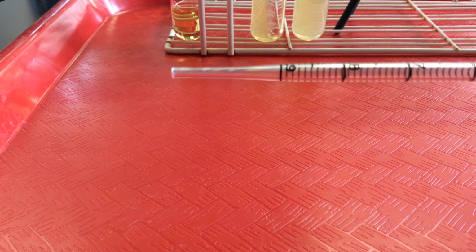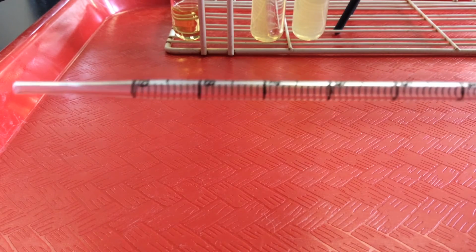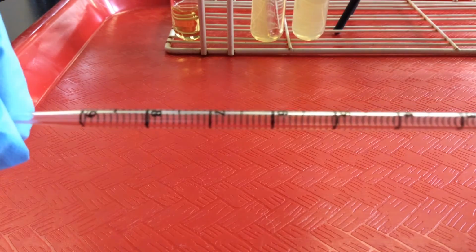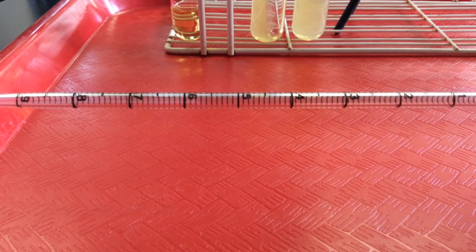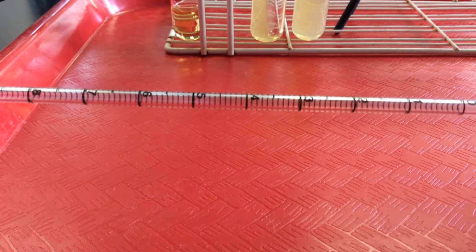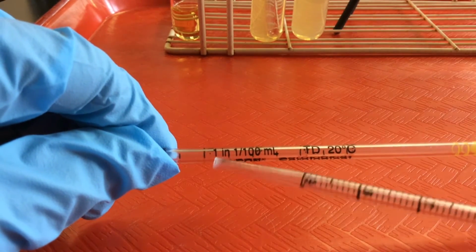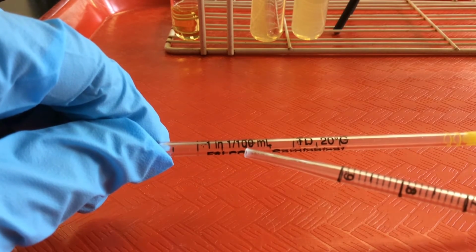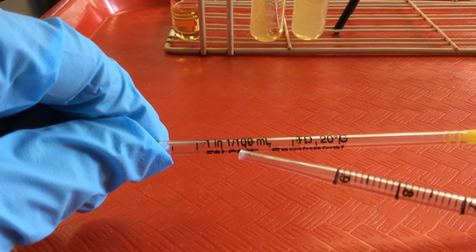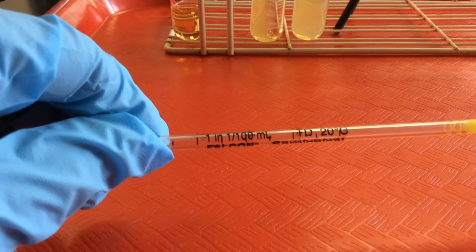This is the end that we would immerse into the fluid that we're going to transfer, and then you can see that there's lines, little units. Some of the units aren't numbered and others are, so we want to know what's the total volume, and then we want to know the volume of the smallest units and the volume of the larger numbered units. So for us to figure that out, we're going to go up here towards the blunt end, and you'll see that there's some numbers here. The first number, 1, tells me the total volume is 1 mL. And then the second number tells me what's the volume of the smallest units. And here we'll see that smallest units have a volume of 1/100th mL, or 0.01 mL.